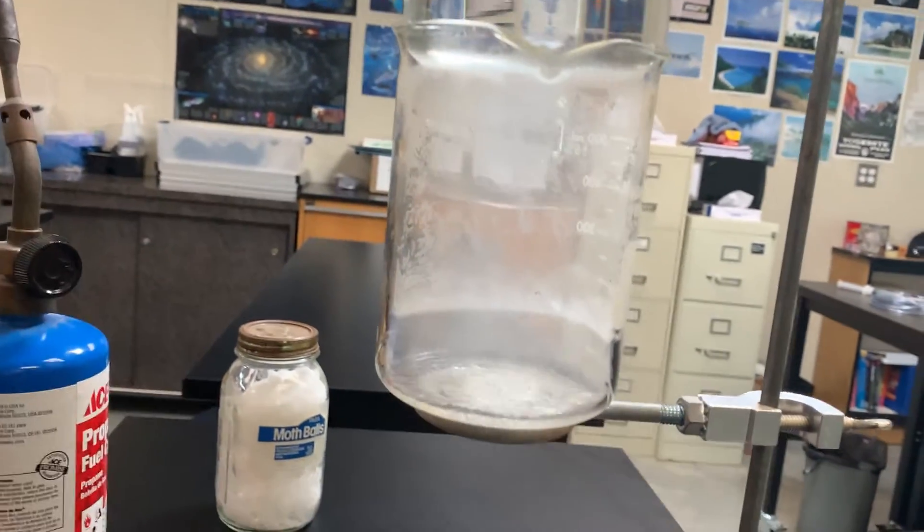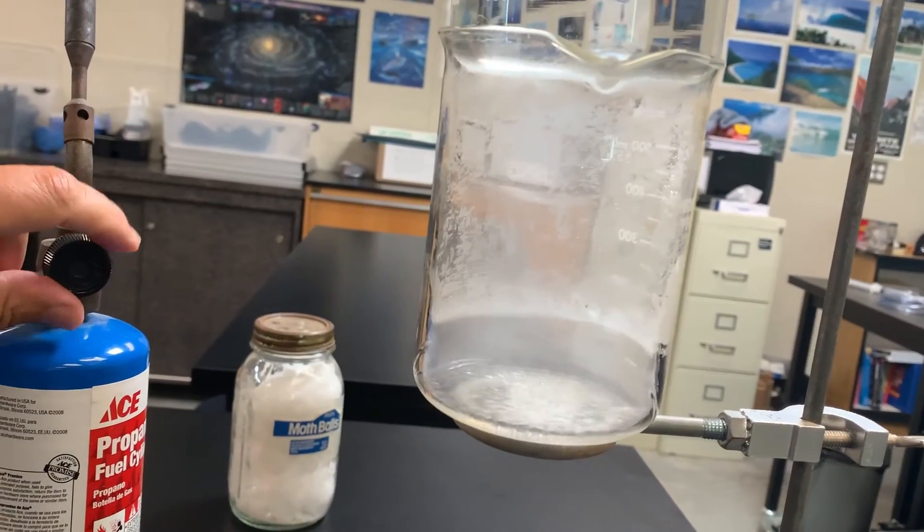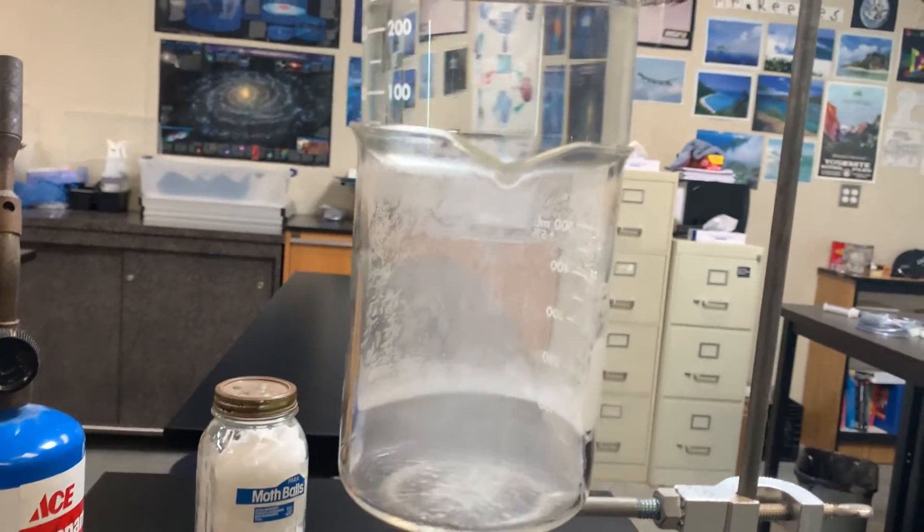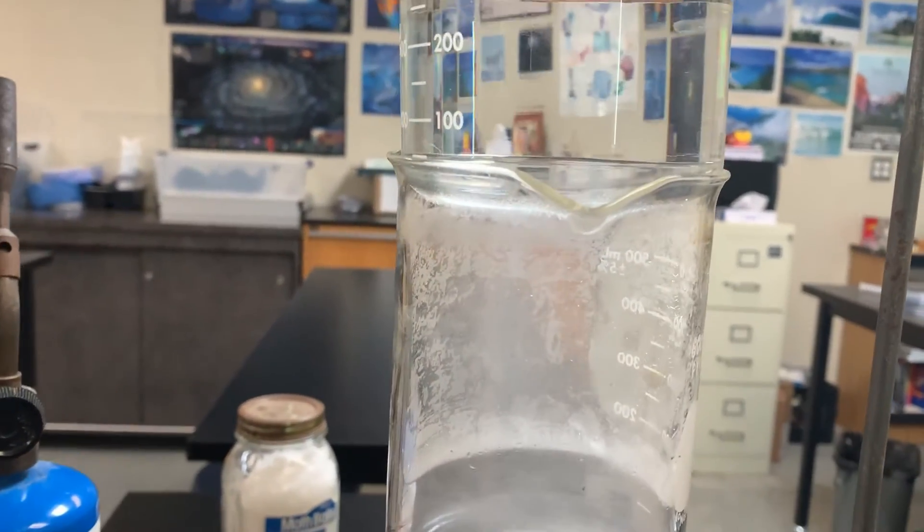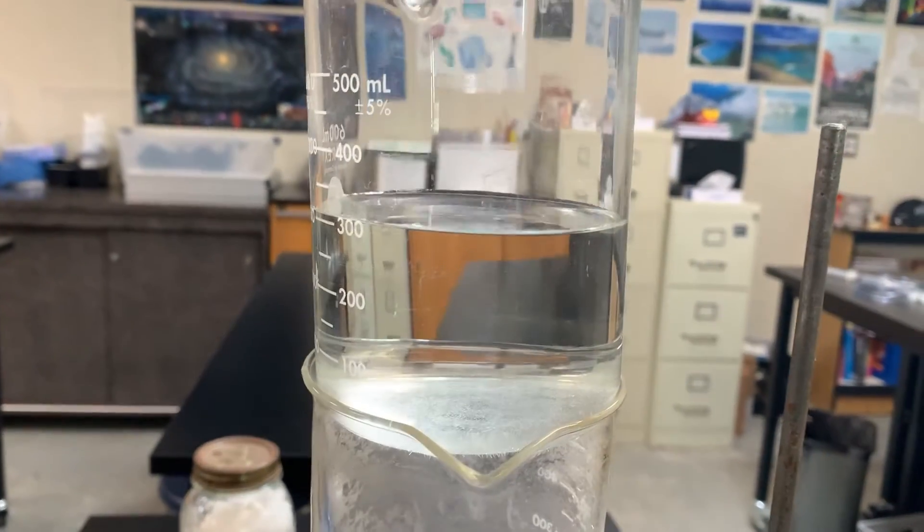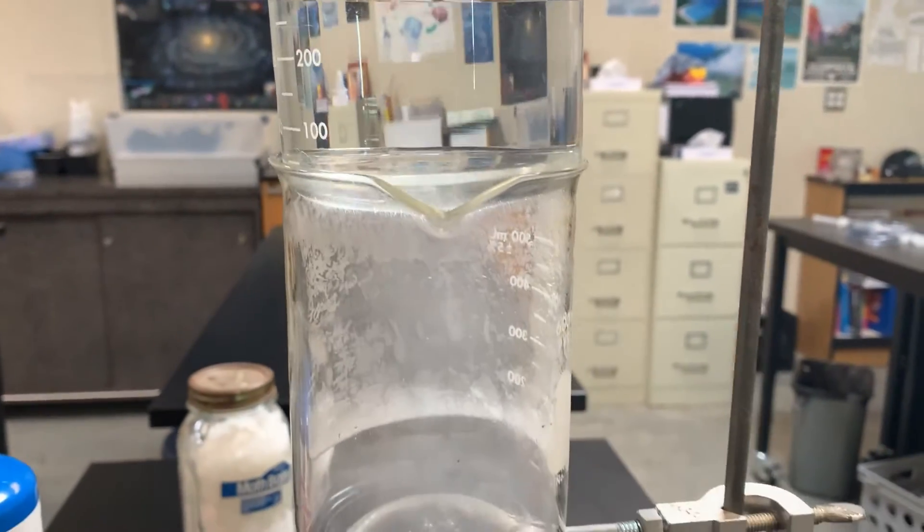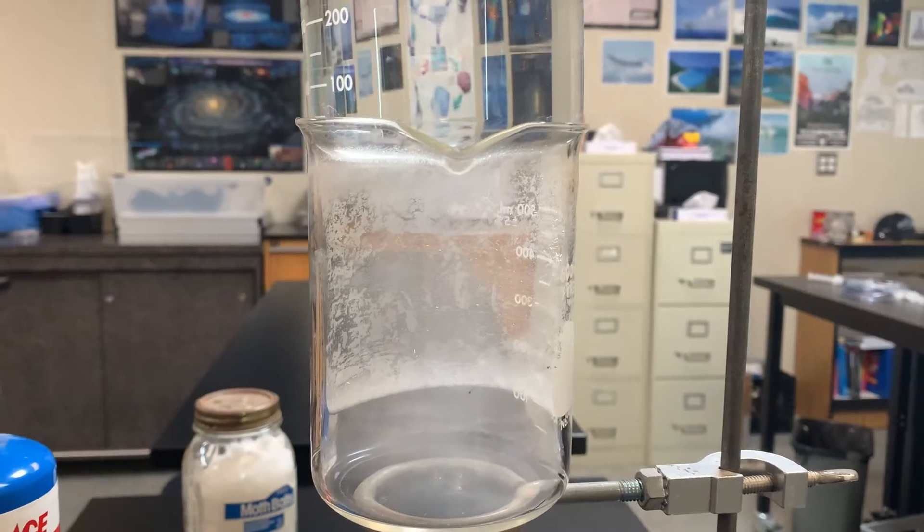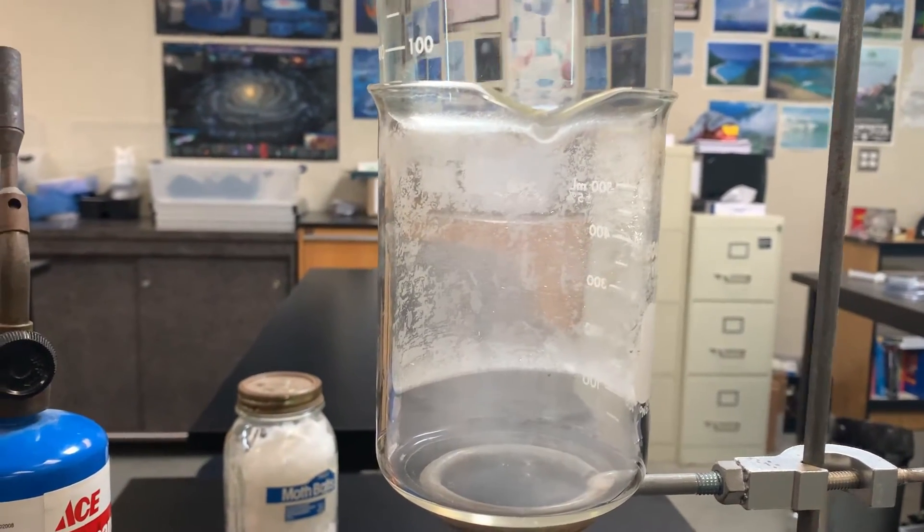Let me turn this off. And it's going to continue to boil for a while. I can hear it boiling. There's the beaker of water on the top. And it's starting to slow down a bit.